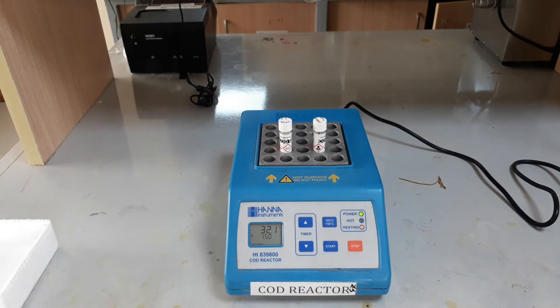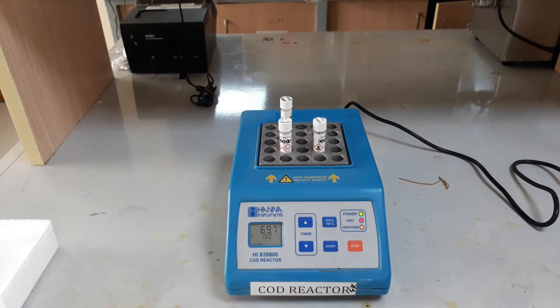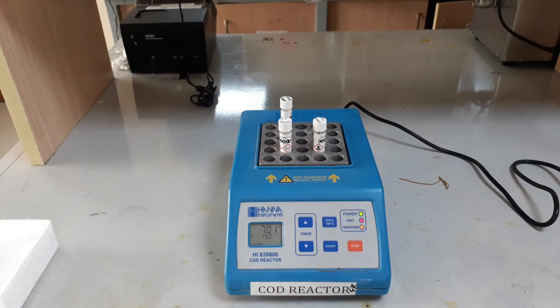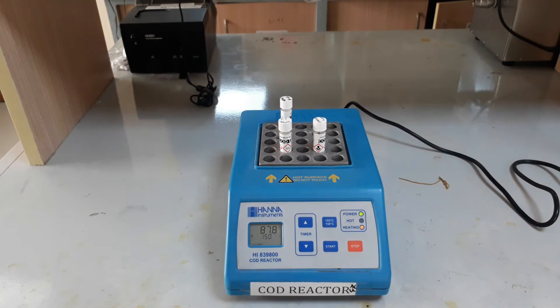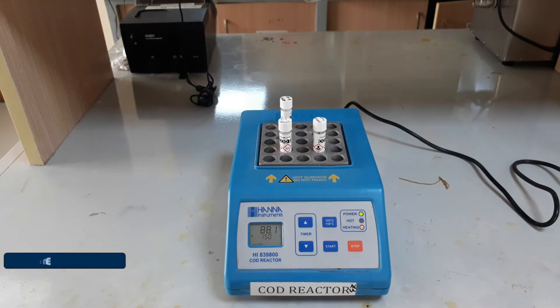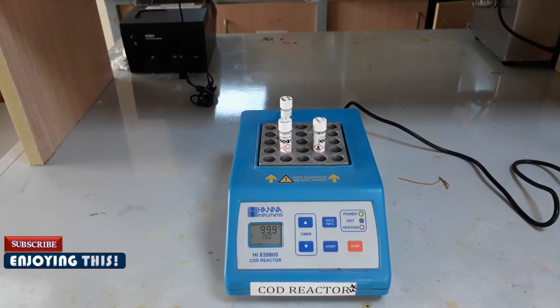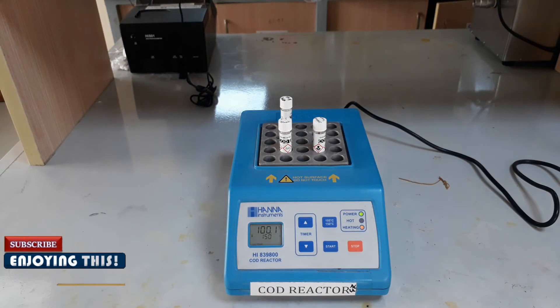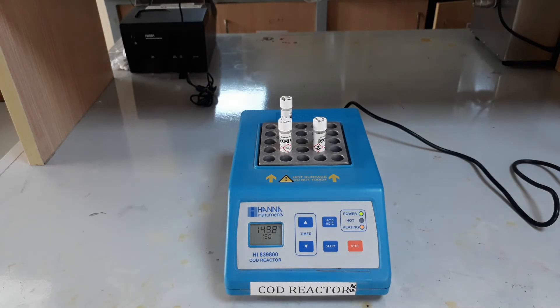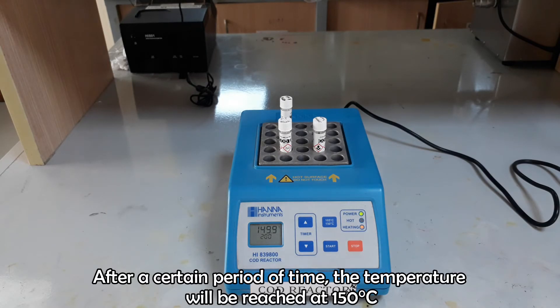COD is the amount of oxygen consumed to chemically oxidize organic water contaminants to inorganic end products. This test is based on the fact that a strong oxidizing agent, under acidic conditions, can fully oxidize almost any organic compound to carbon dioxide.